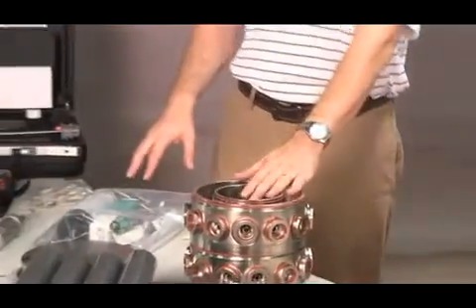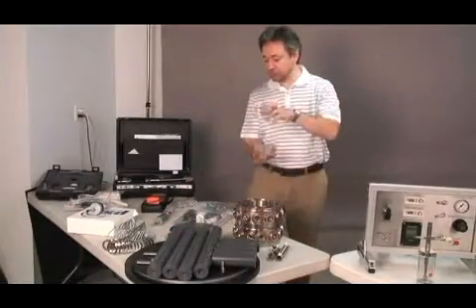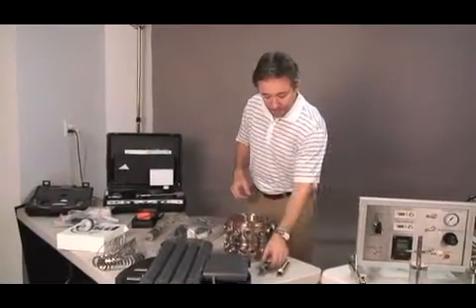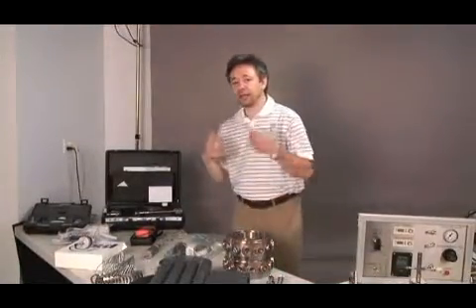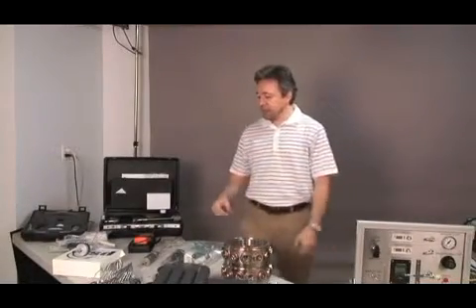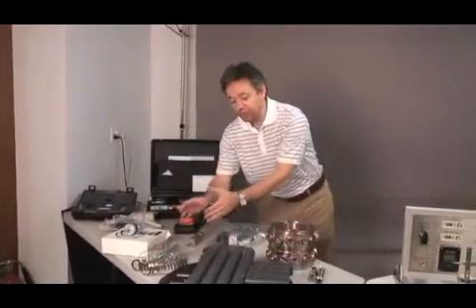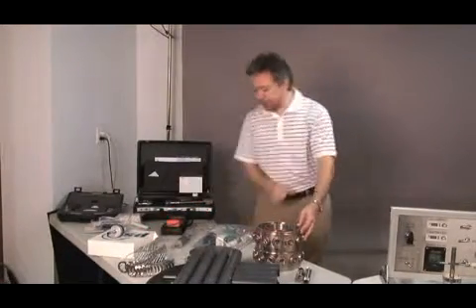Now on this table we have other parts that go into the inhalation tower. This is the upper and lower lids that close the tower. We have the upper swivel and the bottom swivel attached to the diluter. This is an inline diluter that mixes the dilution air coming to the system with the aerosol coming from above. We have the wire supports, 24 of them, for the tubes. So each tube, when mounted on the tower, sits supported by one of these wires.